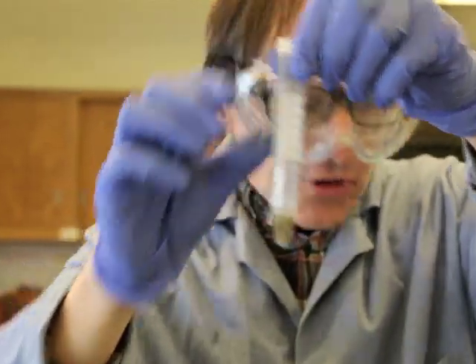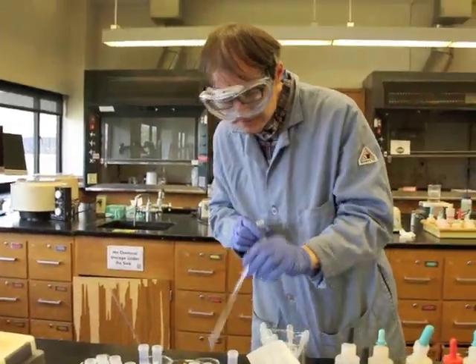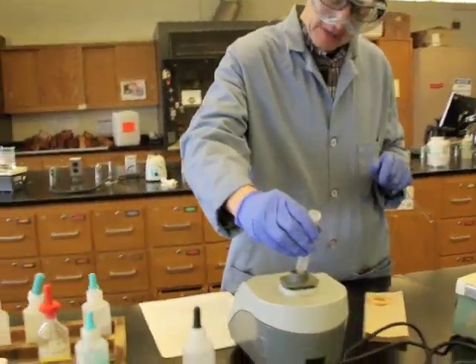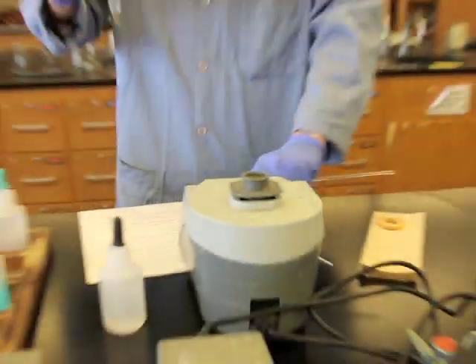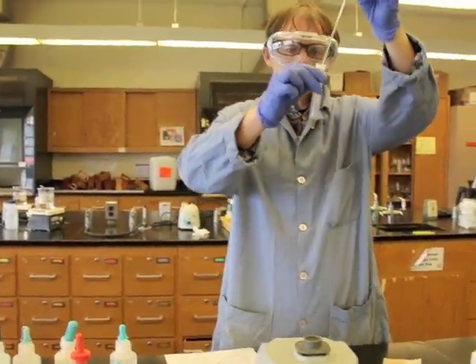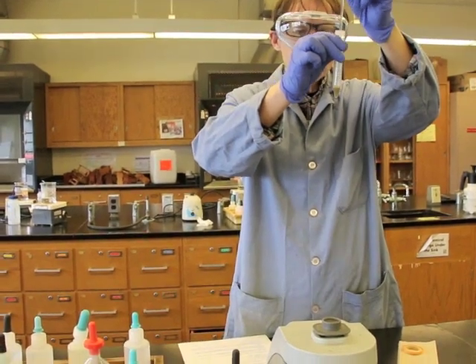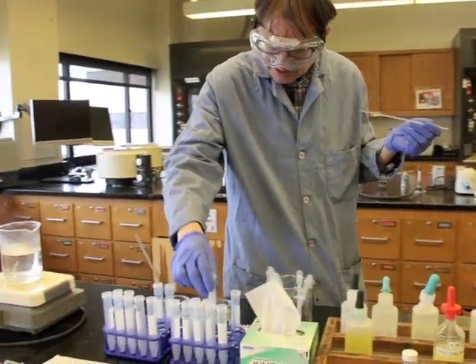And what I'm going to do is I'm going to stir it. Now we have a couple different ways we could stir it. One is using the vortex mixer. So let me show you the vortex mixer. I'm just going to place this on the side and it will mix it really, really well. That's one way to do it. Another more old-fashioned way, sometimes works very well, is just to use a glass stirring rod. Either way is a perfectly fine method in order to mix that up.